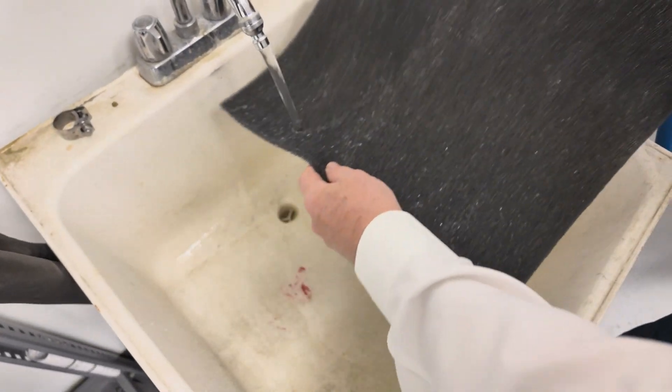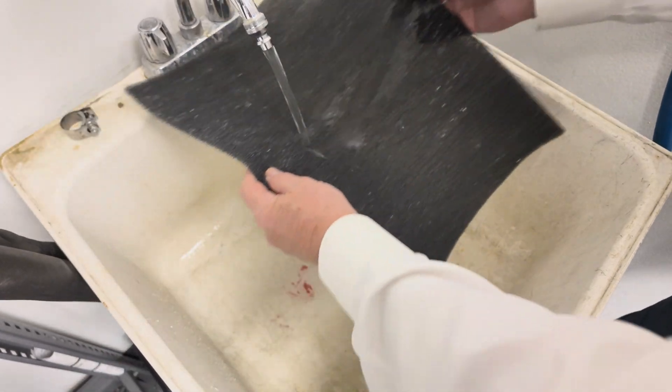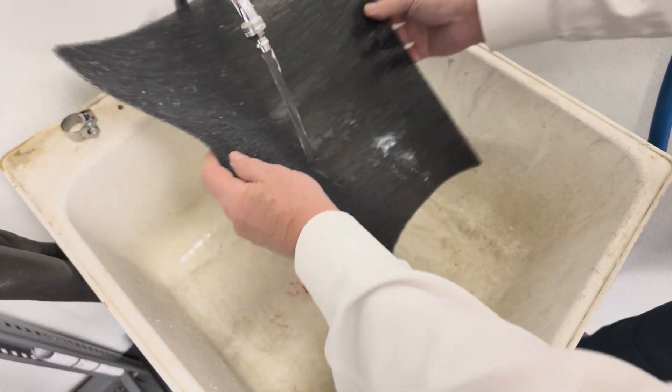The filter can be cleaned with a light spray of warm water in a sink.